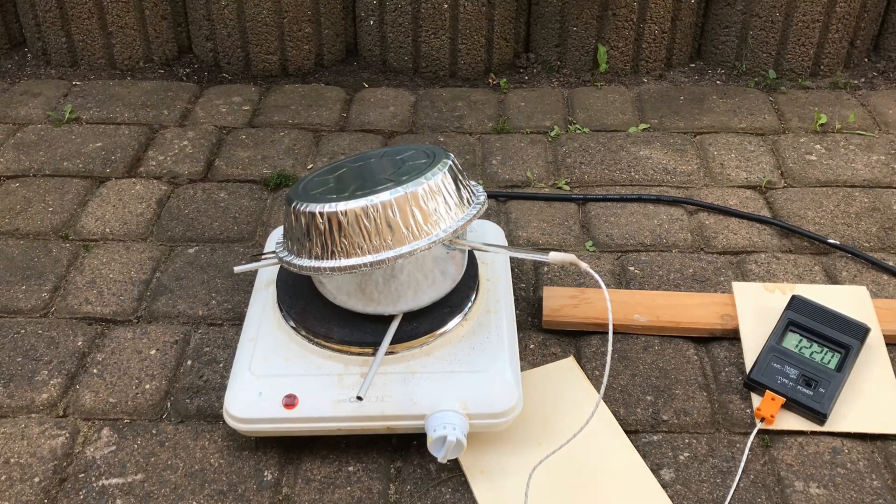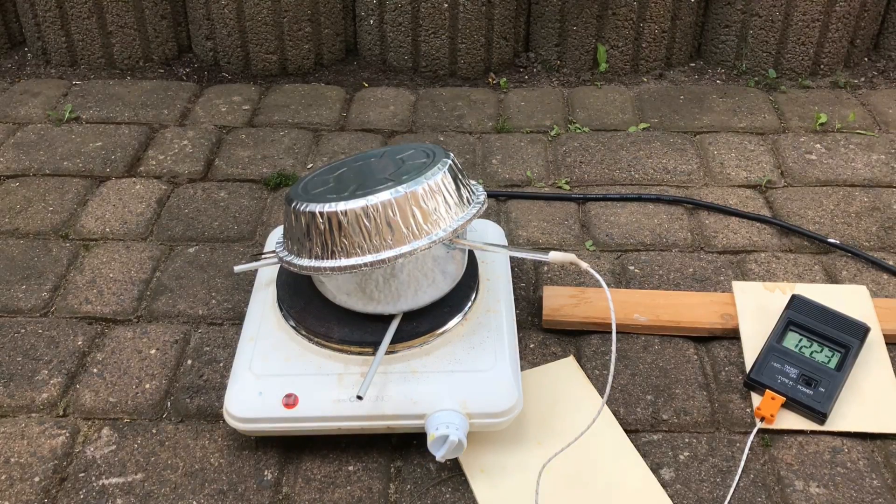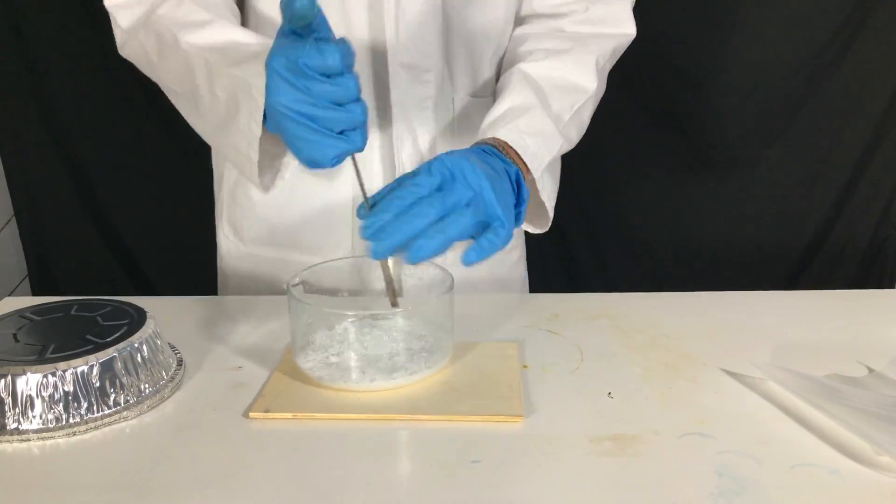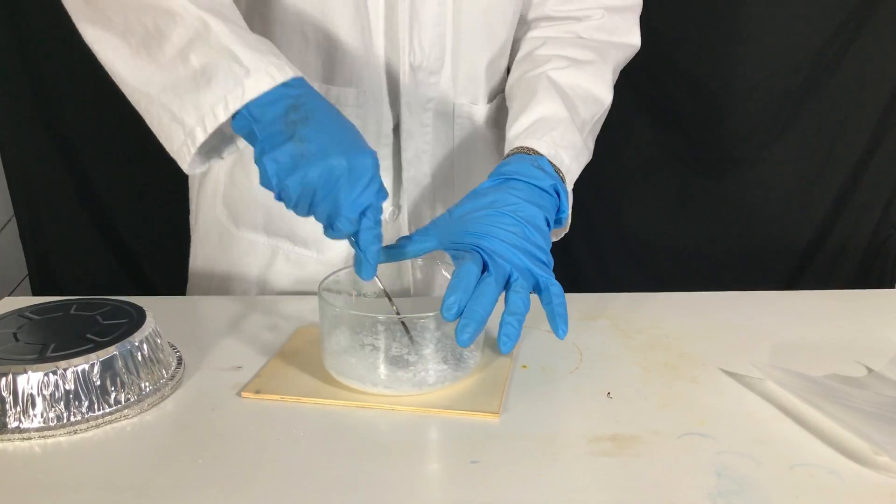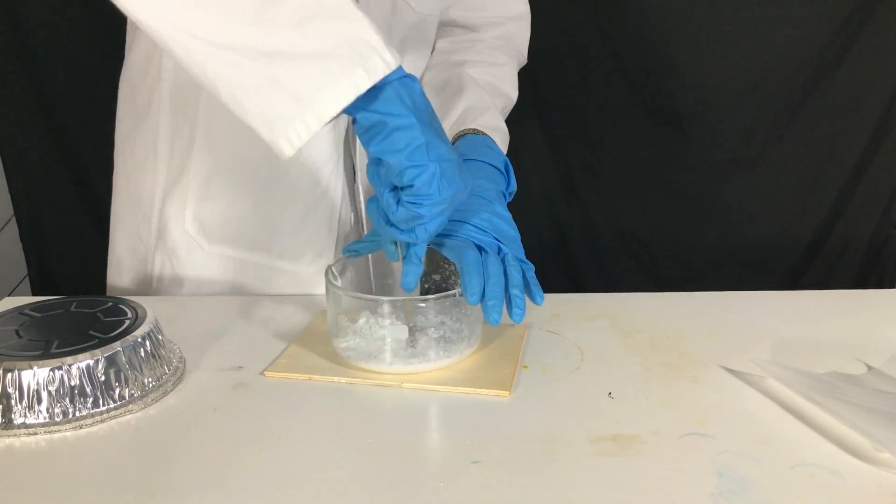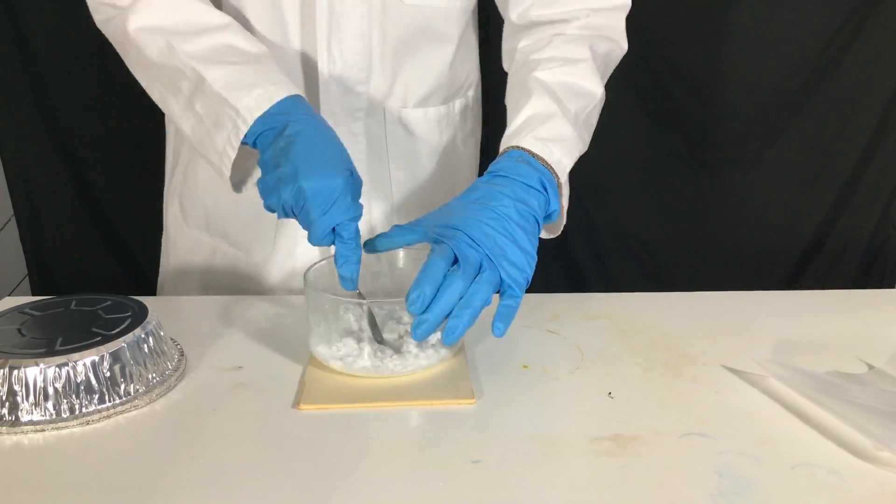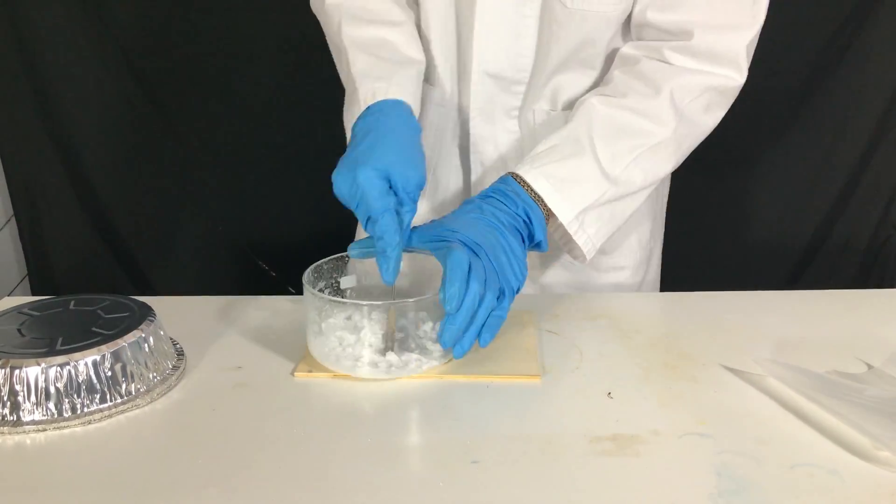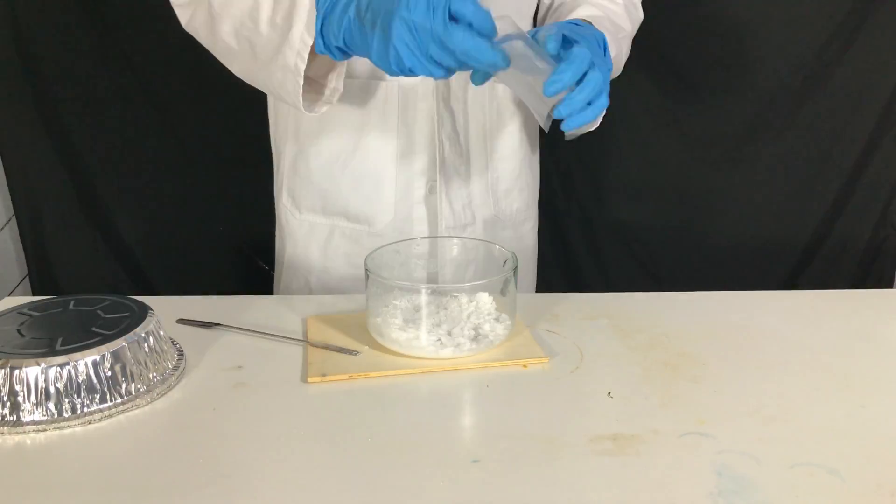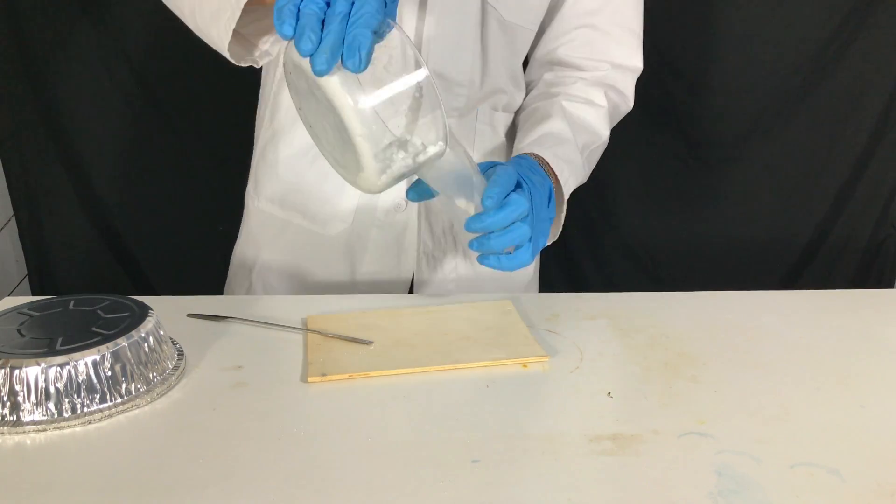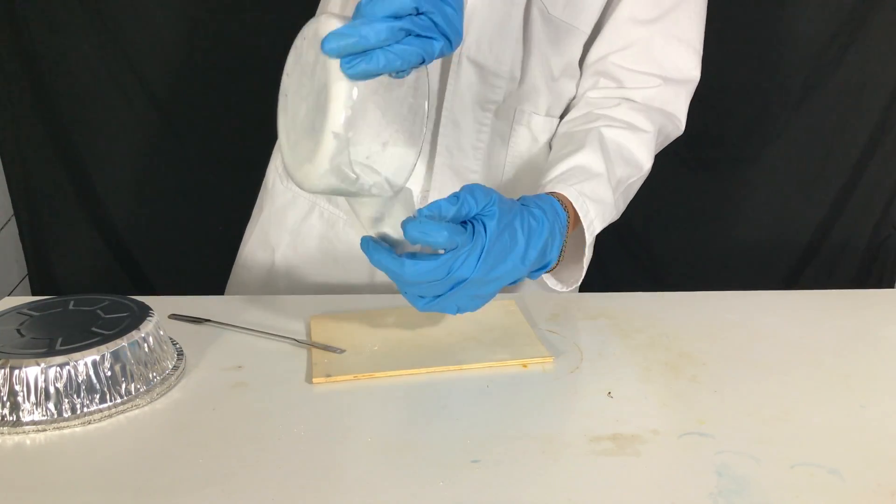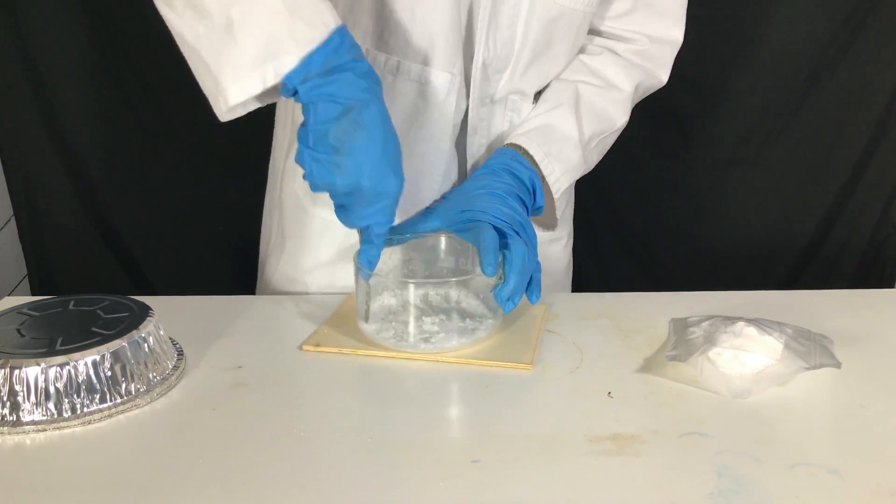Although it looks quite funny, this solution actually works. Back inside, anhydrous sodium formate was gently removed from the evaporation dish using brute force and a spatula. I have to say that I've never had any chemical that was so difficult to remove from some glass.